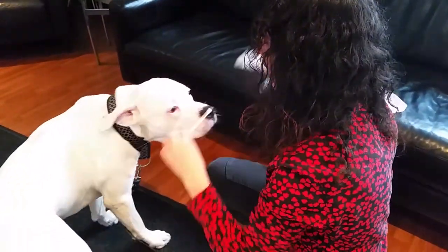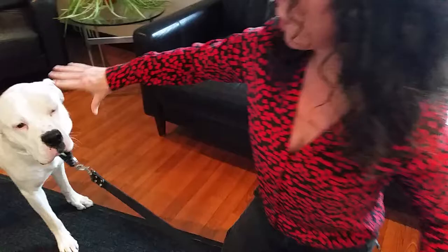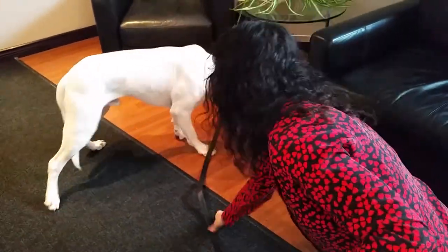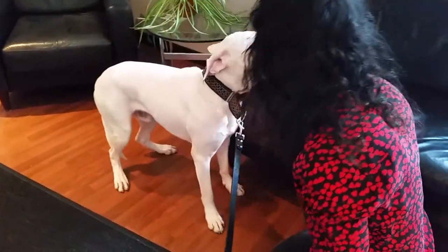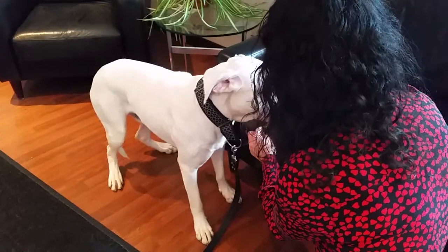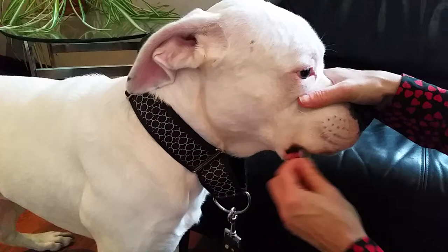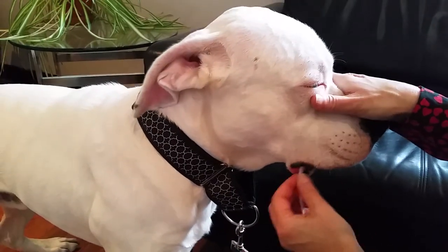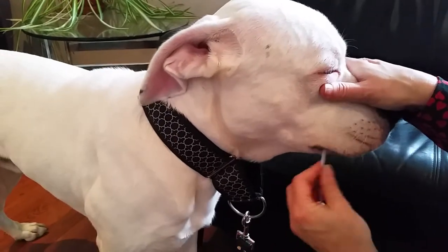Then you're going to take the second sample and do the other side of your dog's mouth. Now he knows what it is. You're going to rub it in between the gum and the cheek for another 20 seconds. You can twirl it a little and just rub it — you're getting cheek cells.